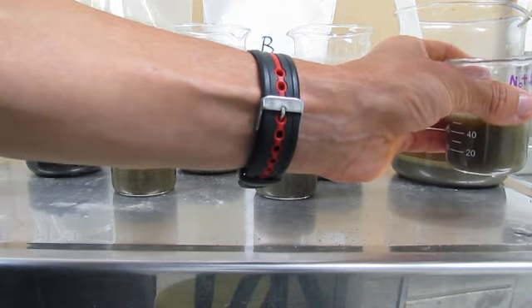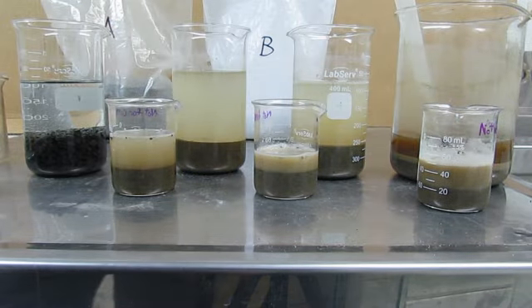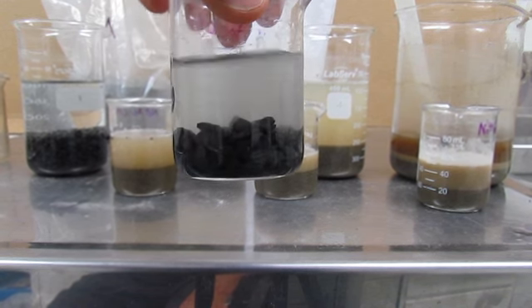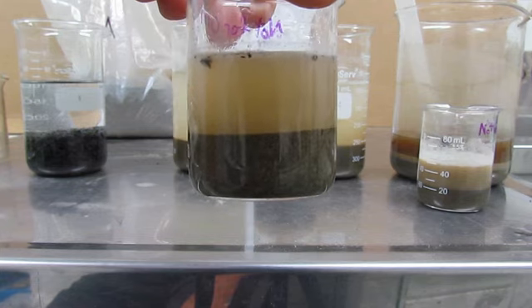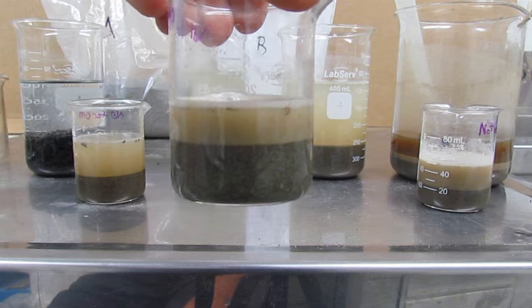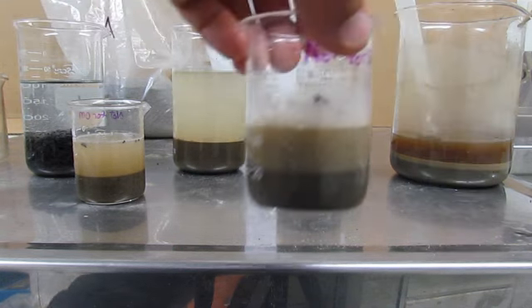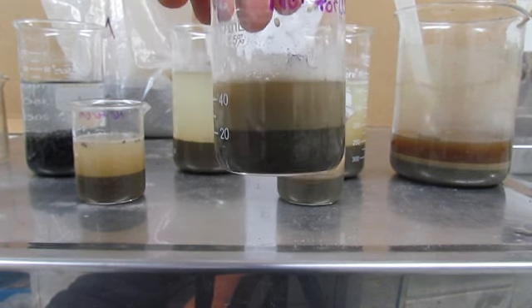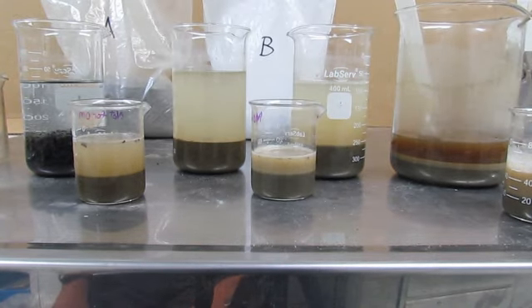So the cloudiness is one measure. As you can see, we've got a nice clean gravel here, and it's nice and see-through. It's very little fines. We've got one with an increasing amount of fines but still tolerable, and this is getting to the point where it's getting quite cloudy, and we'll probably have to wet sieve from that one on. And this one here is very cloudy, you can hardly see through it, and that would definitely be wet sieved. So this is something that we in the lab make that decision for.